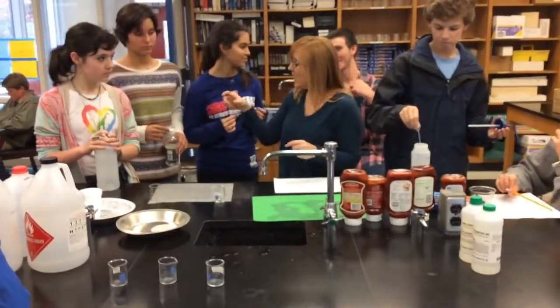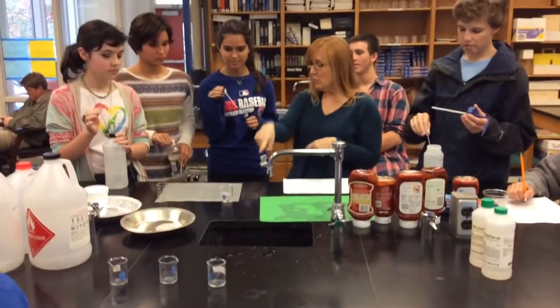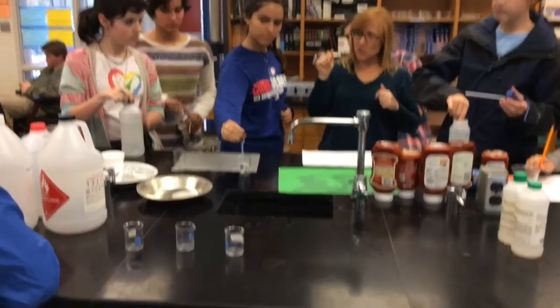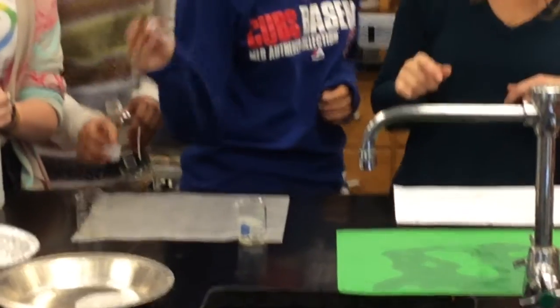I just need you guys to pull up some of it. So squeeze the bulb of your pipette, and I want you to put it in your liquid. Your liquid is right in here. That's acetone. So pull up a little bit of your liquid into your pipette, and we're just going to place a couple of drops of your liquid.